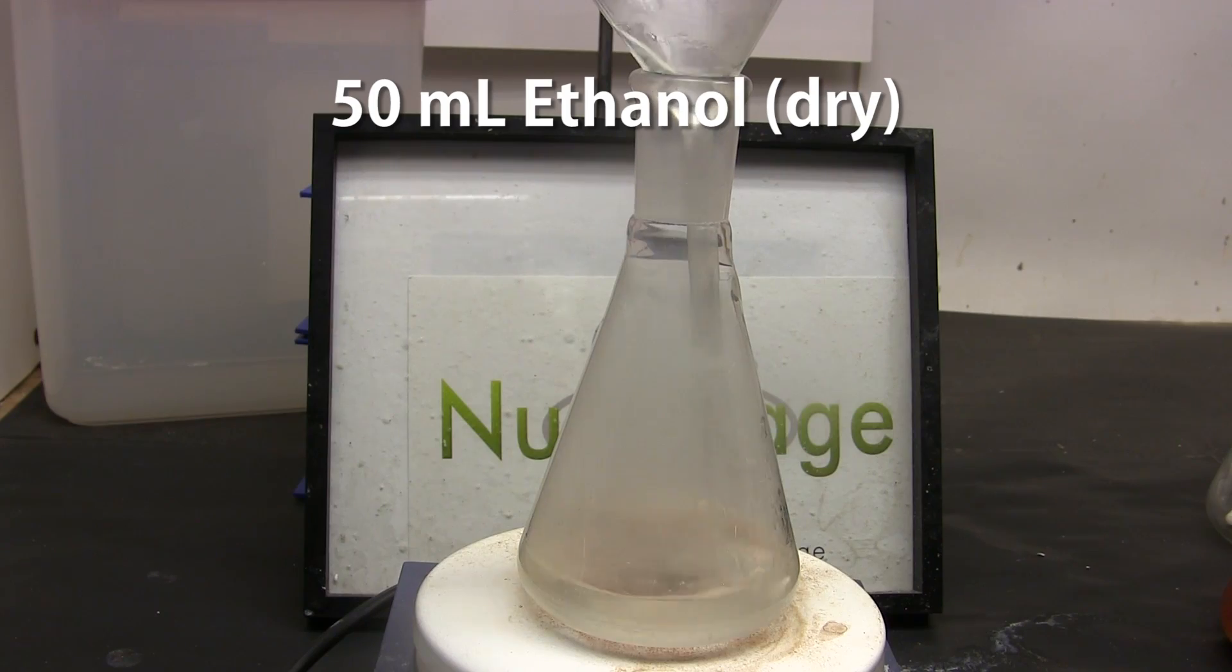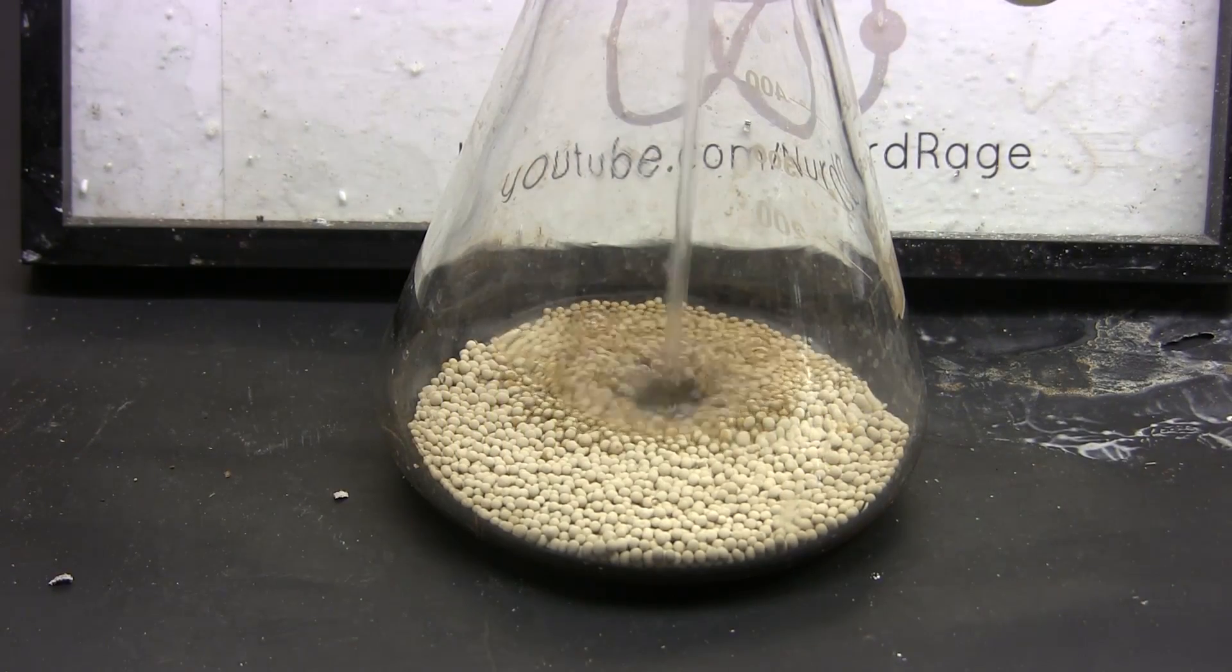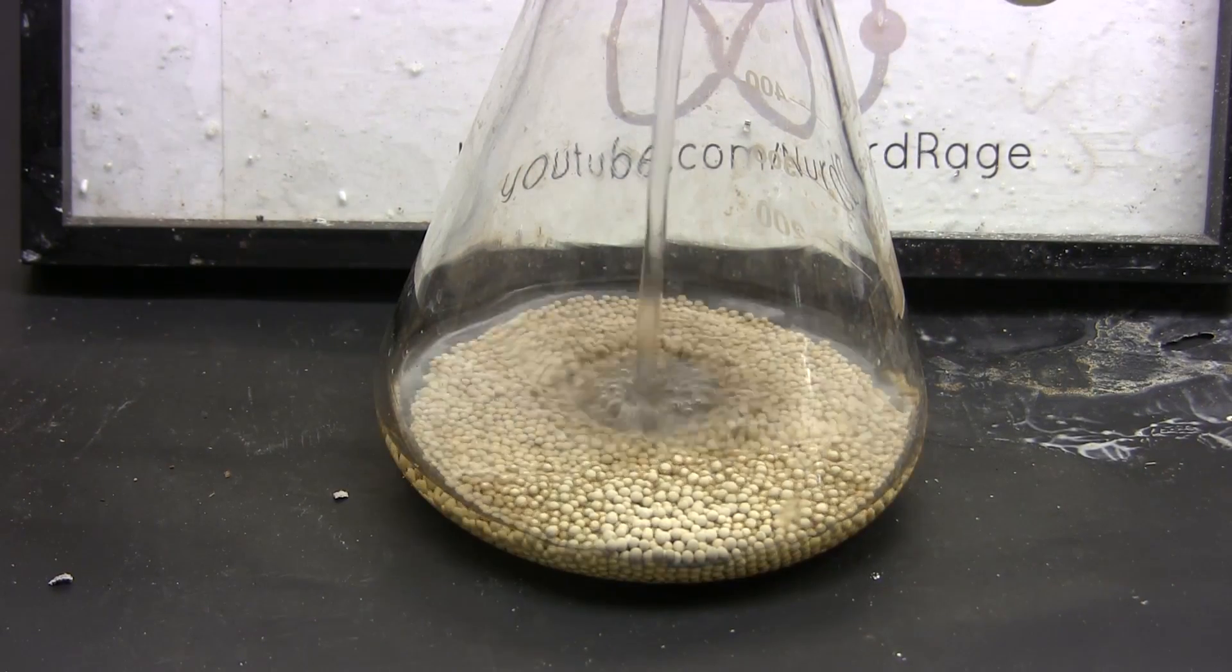Then we add to that 50 mL of dry ethanol. This ethanol was previously dried using molecular sieves that we demonstrated in a previous video.